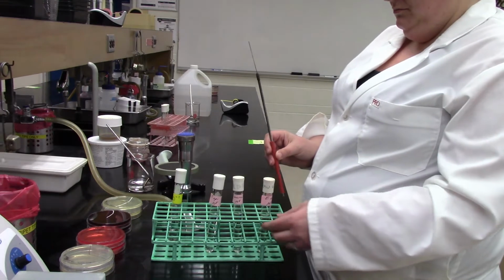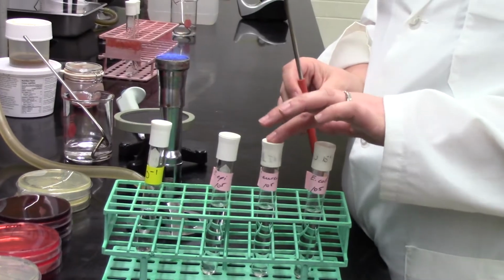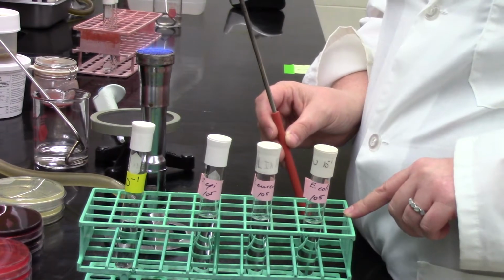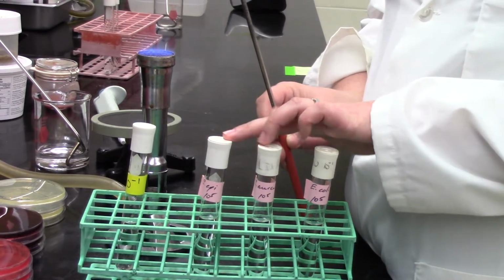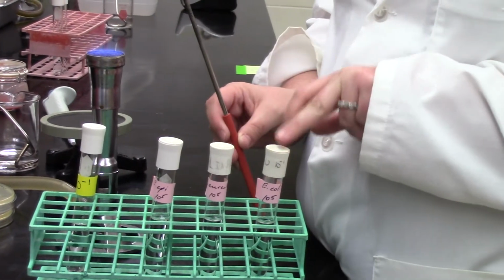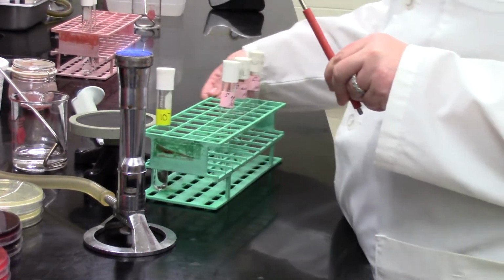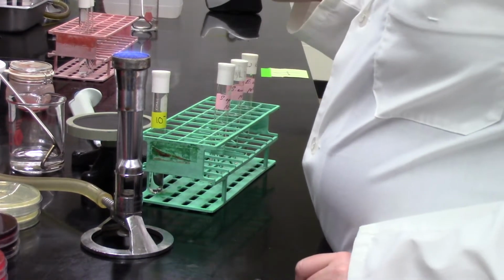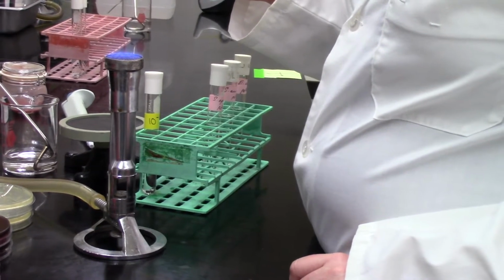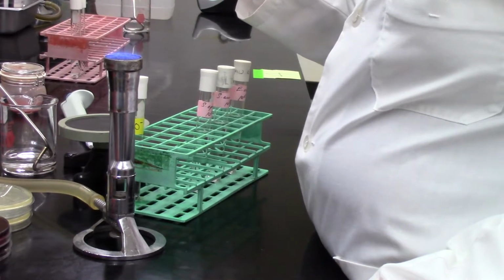So the 3 bacteria we're working with here are, and I can zoom in a little bit to see, although it's still going to be tricky to actually see them, but there's our tubes. So we have Staphylococcus epidermidis, sort of the closest to the Bunsen burner there. We have Staph aureus, or Staphylococcus aureus, and then we have E. coli, or Escherichia coli. So you guys, I'm not going to say what type of bacteria these are as we go through, and that will be a little exercise for you guys to do to see what you would predict to see on these selective and differential media plates once we actually culture these bacteria on them.